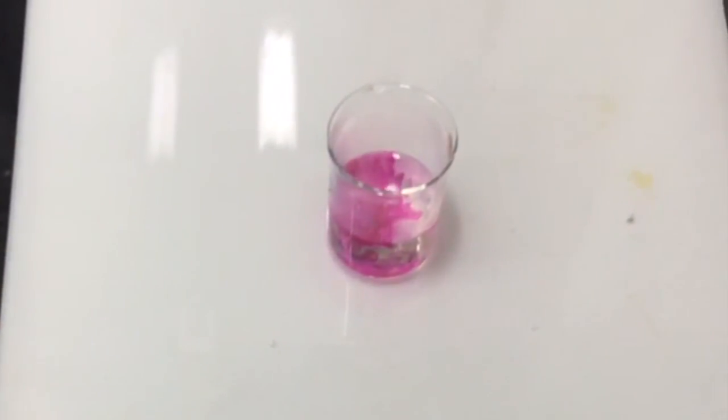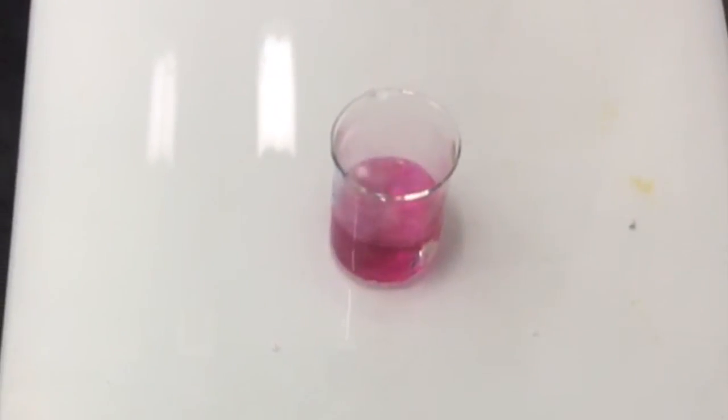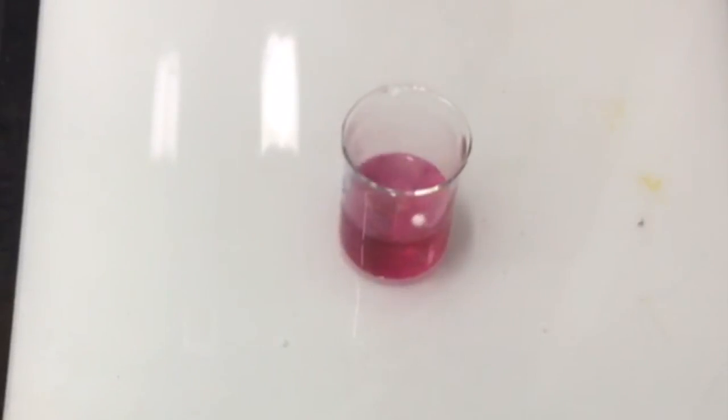In the second trial, less hydrogen gas was produced, so while there was no flame, the sodium hydroxide was abundant throughout the whole beaker, indicated by the dark pink color of the phenolphthalein.